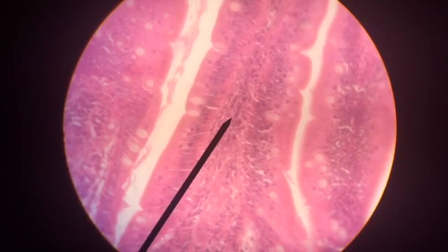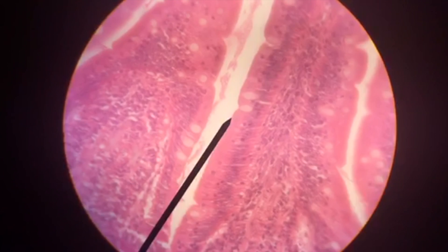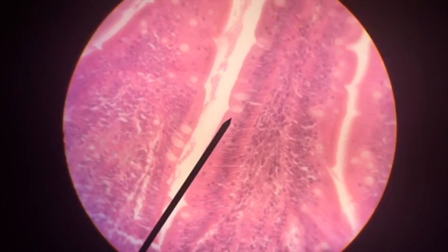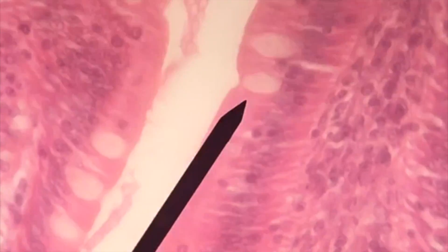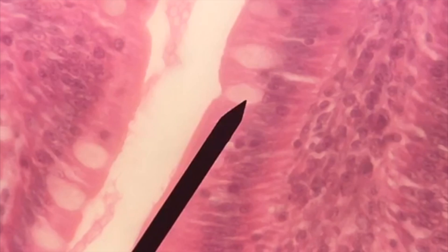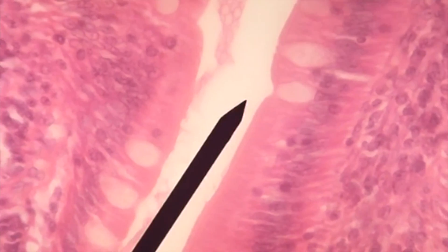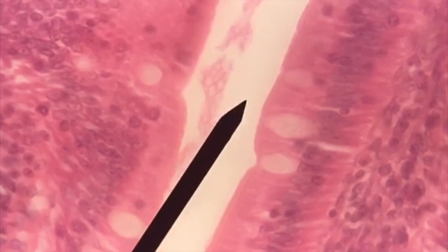We're now going to move on to a nice cross-section of the small intestine. We're looking here at a finger-like projection, or villi. We're going to notice, as we zoom in, that we have a nice simple columnar arrangement of epithelium where these cells are oriented in a soldier-like fashion from the apical surface down to the basement membrane. The pointer is pointing to our first modification, which is a goblet cell. It's going to secrete mucus onto the surface of this epithelium, hence our mucous membrane.